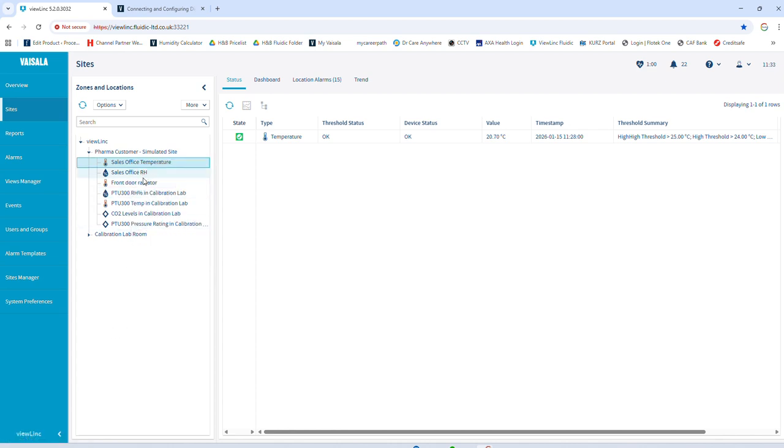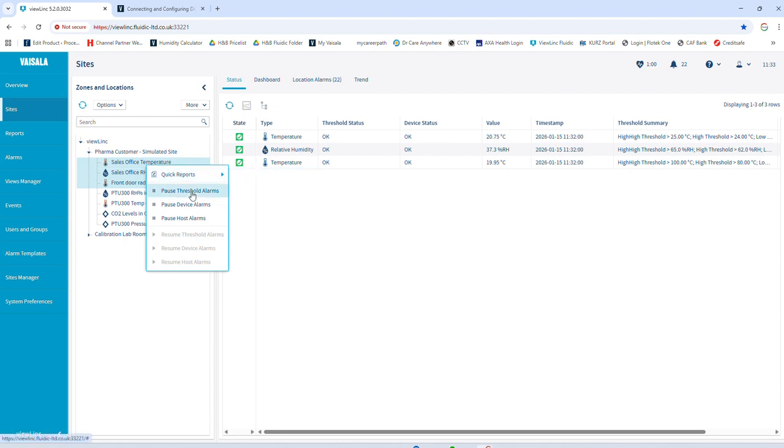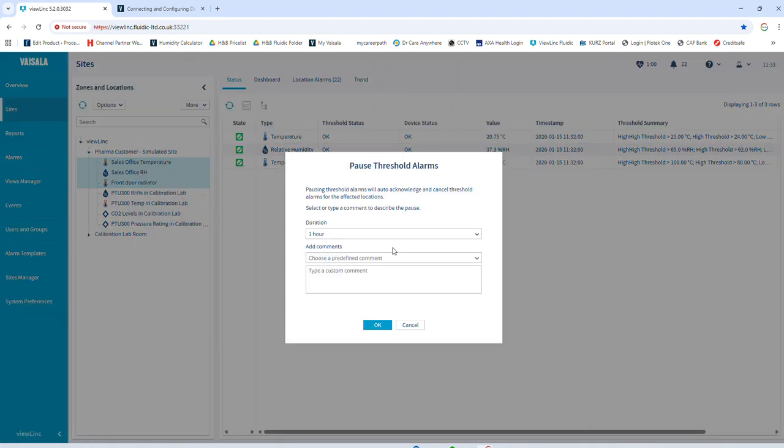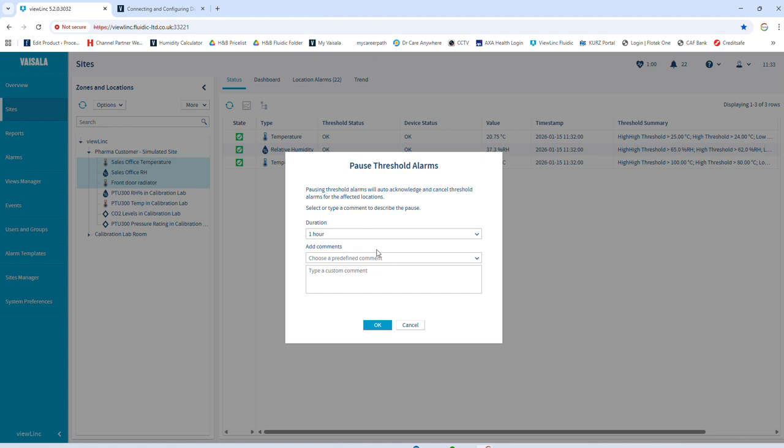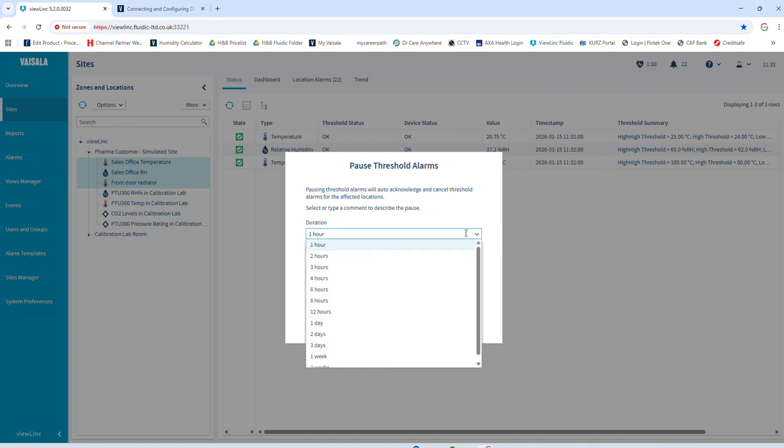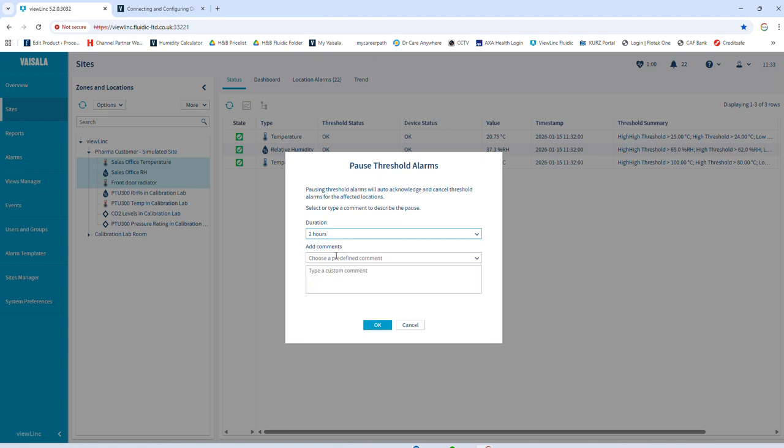Now, just to show you, you can actually select multiple and right click and pause threshold alarms. And just before I do this, you can see up there, threshold status, everything's okay. Pause the threshold alarms. Now, I really like this feature. Duration. So you could set it for an infinite amount of time or 2 weeks, right? If you want, because you can manually unpause it. But the benefit of this is if you think, it's going to take me an hour, okay, I'll pause it for 2 hours. It means if you forget to manually reset it, it will automatically do it after 2 hours. Now, you can put in a little comment there, defrosting freezer, for example.